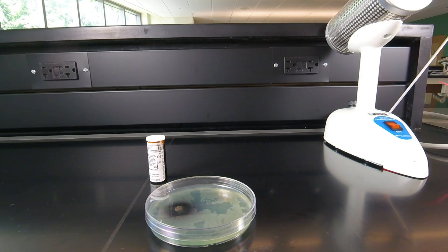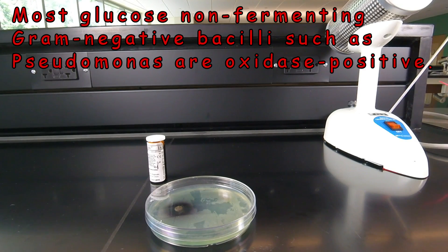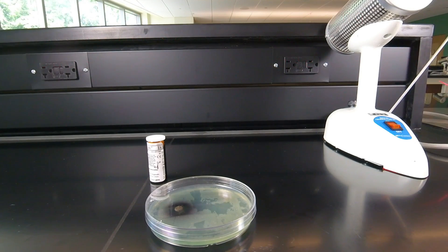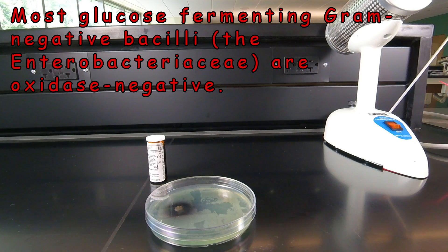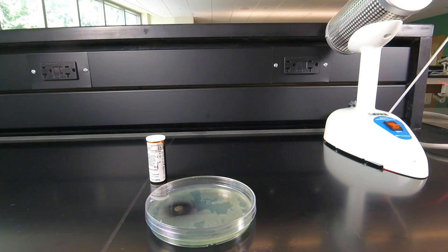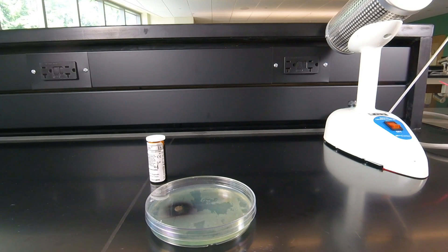Another important use of the oxidase test is to help differentiate glucose-non-fermenting gram-negative bacilli, such as Pseudomonas, most of which are oxidase positive, and glucose-fermenting gram-negative bacilli, such as the bacterial family Enterobacteriaceae. With one exception, the Enterobacteriaceae are oxidase negative. We're going to learn how to do both the immediate and the delayed oxidase test using the Taxo N-disc.